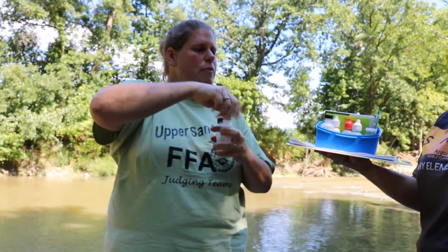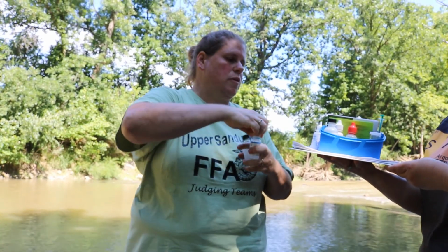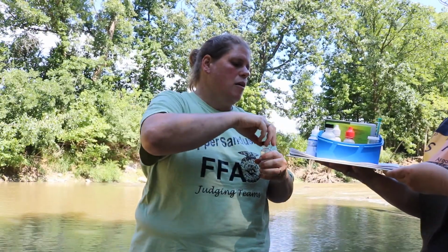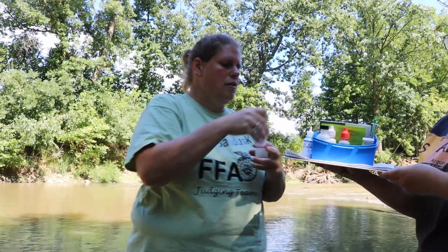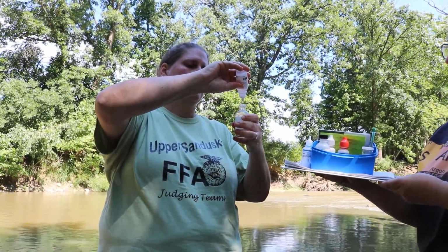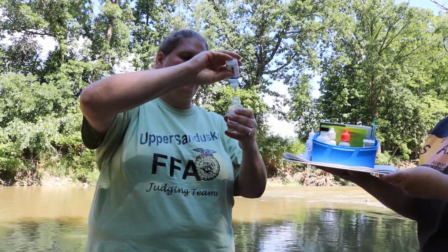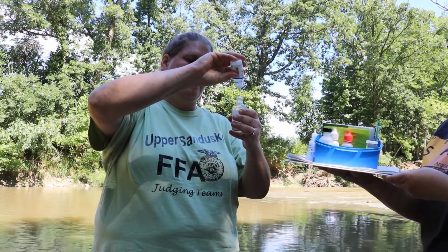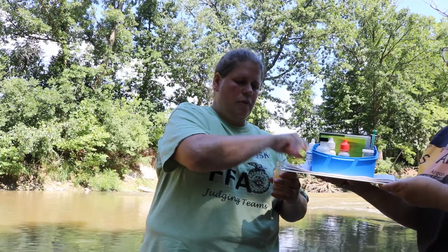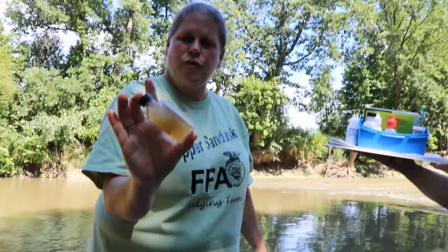So we have 2 different chemicals that we're going to drop in here to fix it, and we're going to get a precipitate that forms. I call those floaties. So we're using manganese sulfate and an alkaline potassium iodide. This test kit calls for 8 drops of each. We're going to cap it and invert it. You can see there's a precipitate that's formed in the bottle.